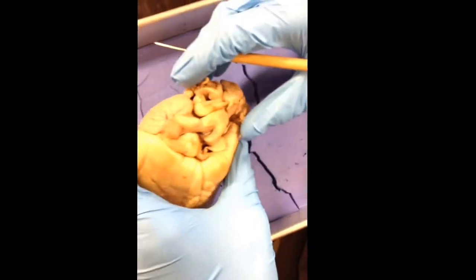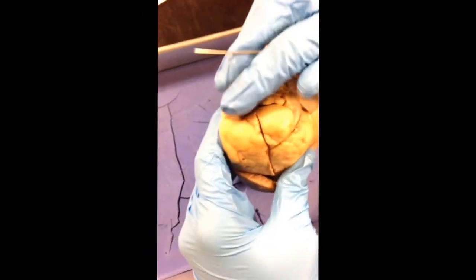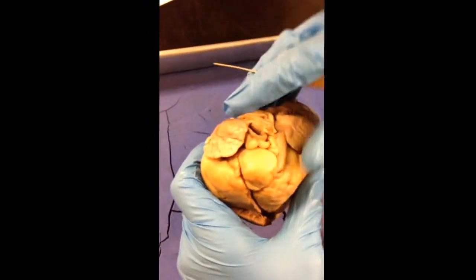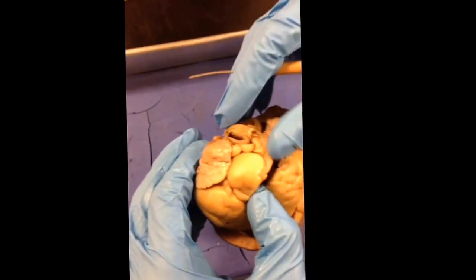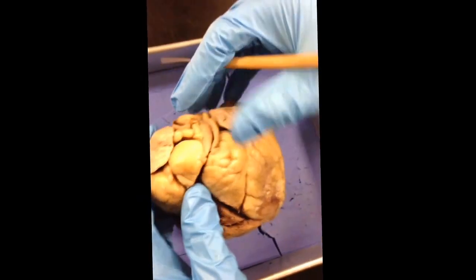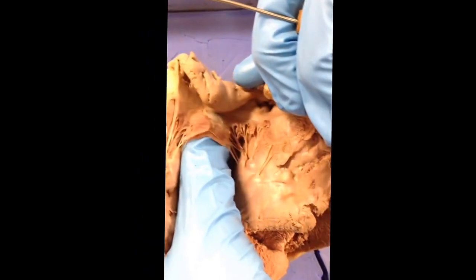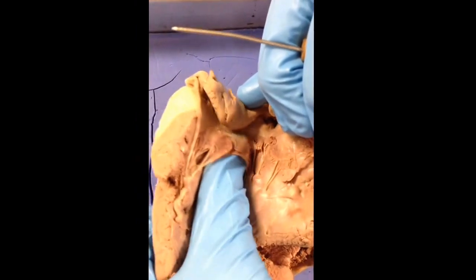After that comes the right auricle, which is on the left in your perspective, and it's the brown thing on the top. After that is the pulmonary trunk, which is right there. Then comes the tricuspid valve, which is in the middle of the right atrium and ventricle, and it's a flap connected with the chordae tendineae.